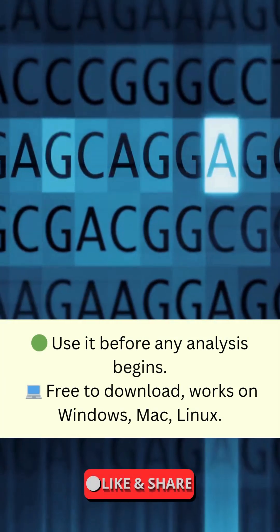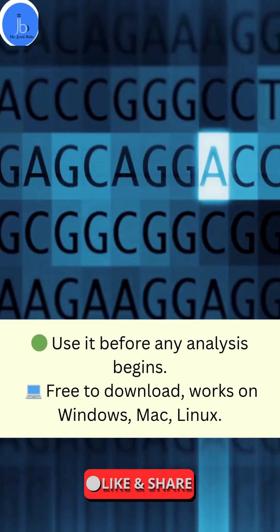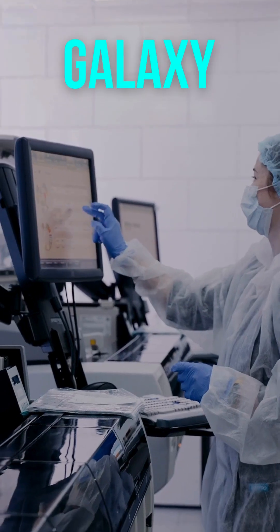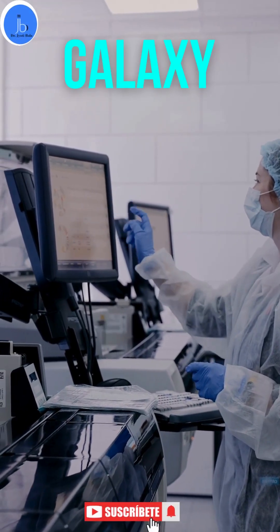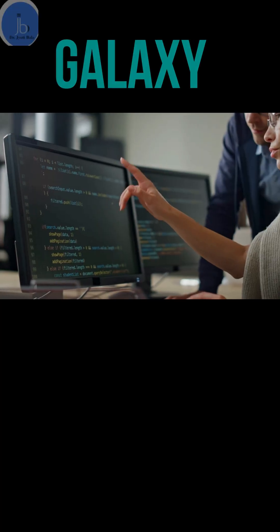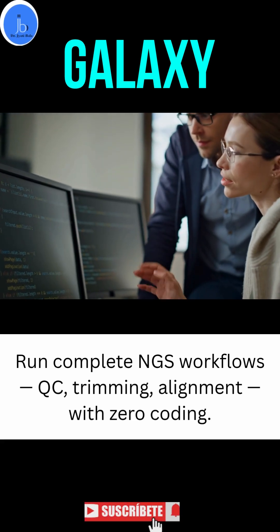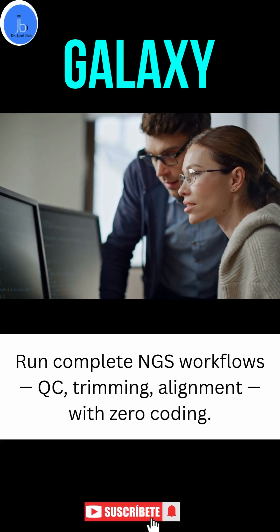It's free to download and works on Windows, Mac, and Linux. The next one is Galaxy. It's like a drag-and-drop lab in your browser. You can run complete NGS workflows — sequence trimming, alignment — with zero coding knowledge. It's preferred for beginners and educators.